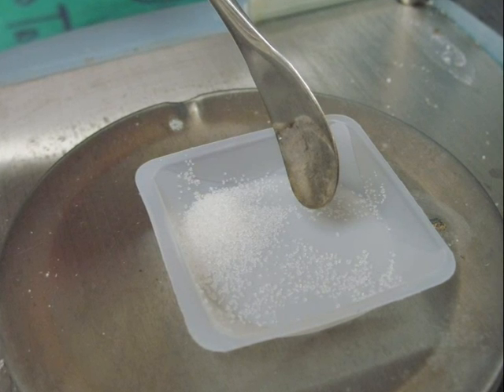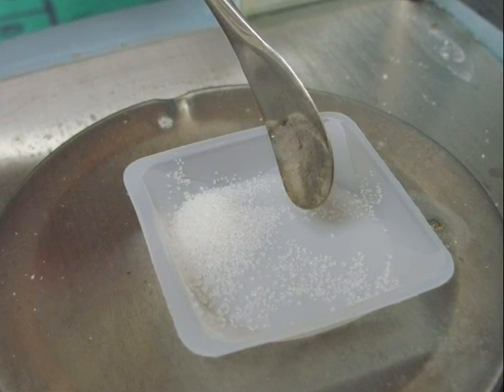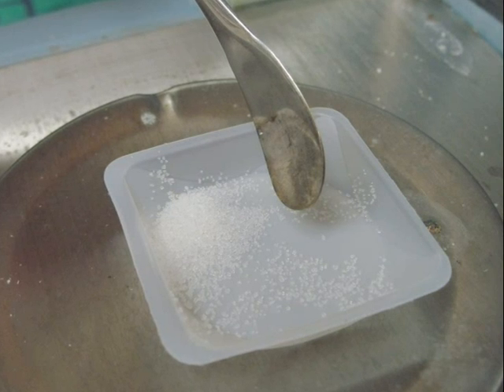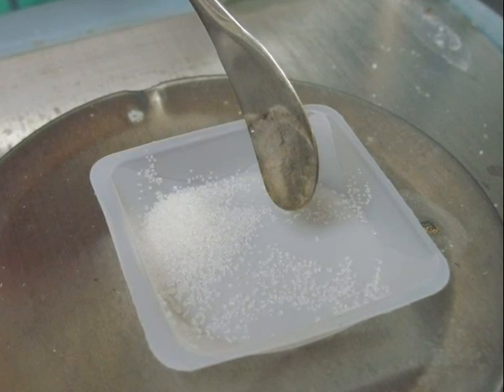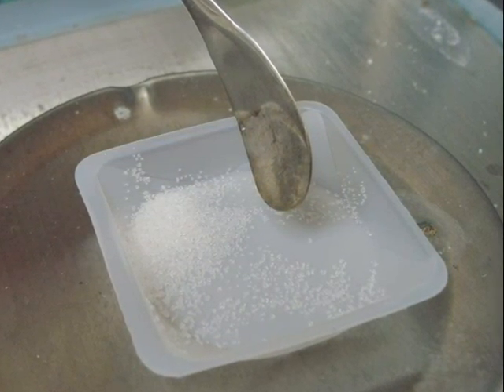Weigh three samples of the unknown, each having a mass between 0.2 and 0.4 grams. Record the mass and your unknown number.